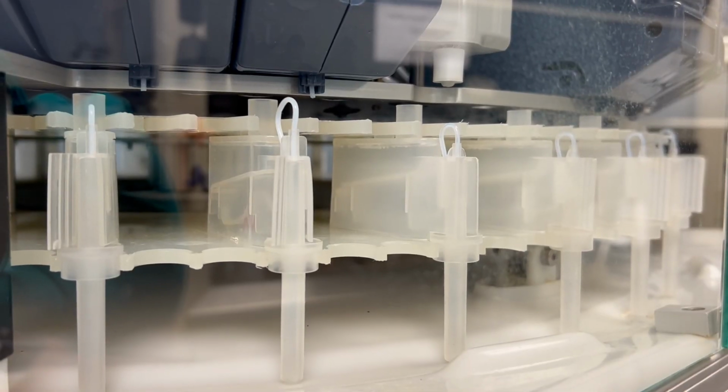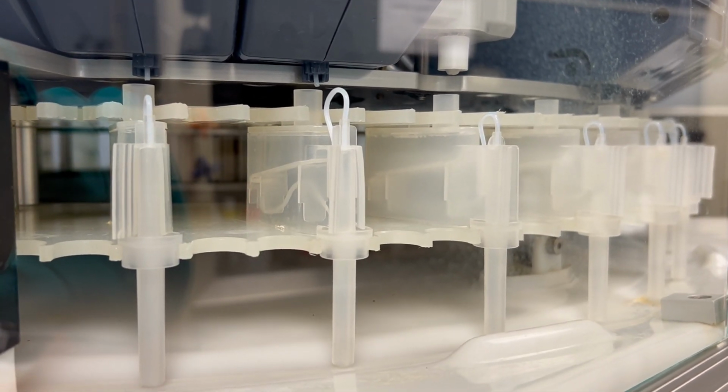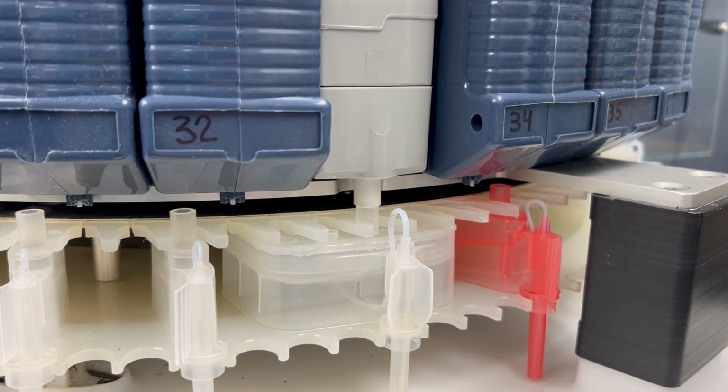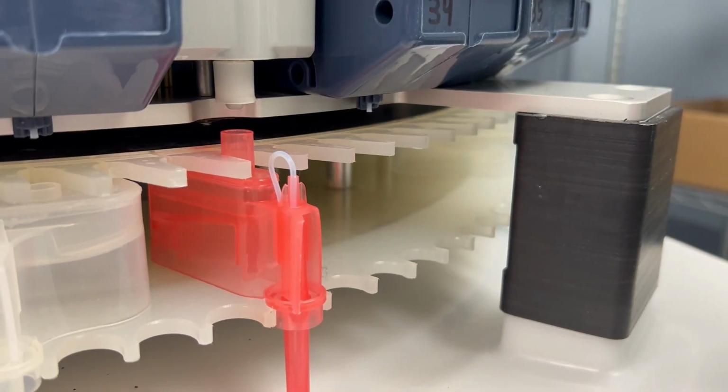Thanks for joining us for this long-form TETRAS Workflow demo. With Tetras, you don't have to wait for one synthesis to finish before starting the next. You can keep your workflow moving without interruption.